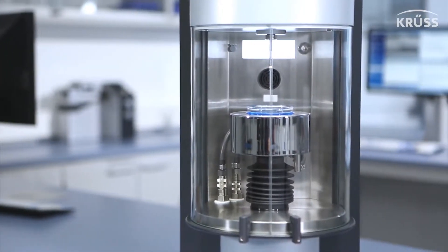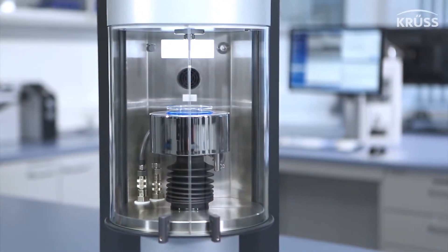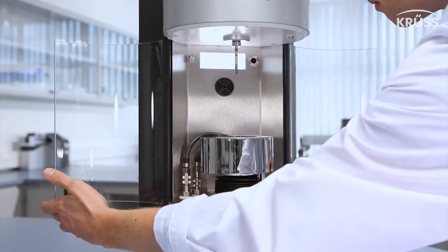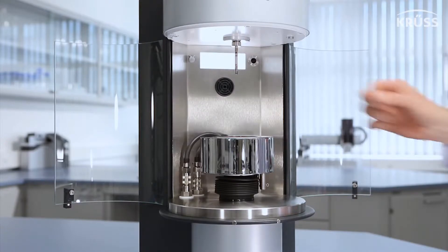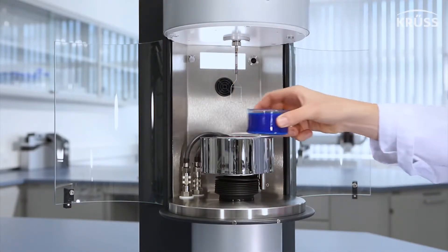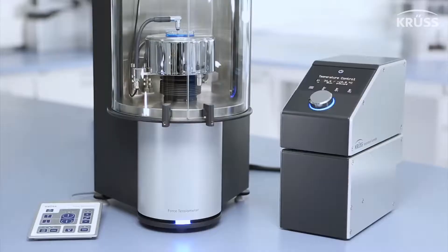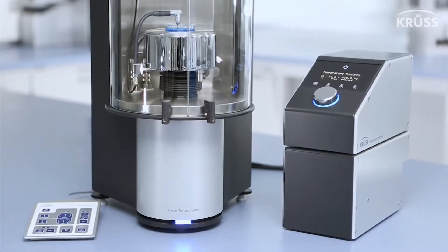All of these useful and versatile instrument components are housed in an extra-large sample chamber, which is finished with chemically resistant and easily cleanable stainless steel. The sample chamber features two durable glass doors which open very widely to offer easy sample loading and adjustment, and which protect the measurement from wind disturbances.